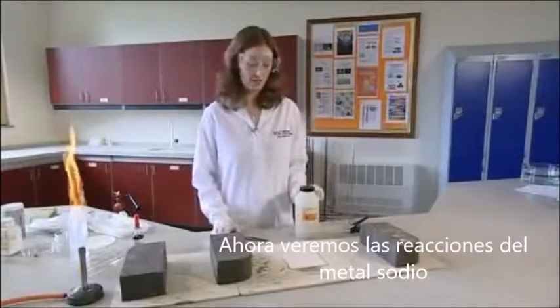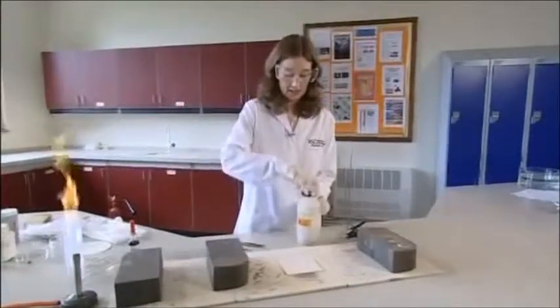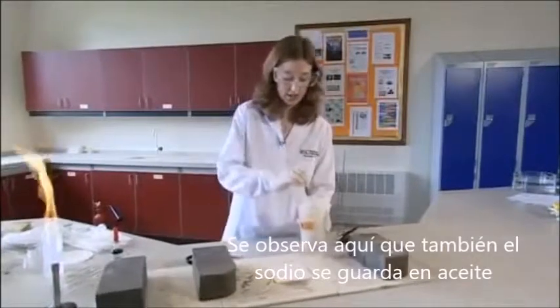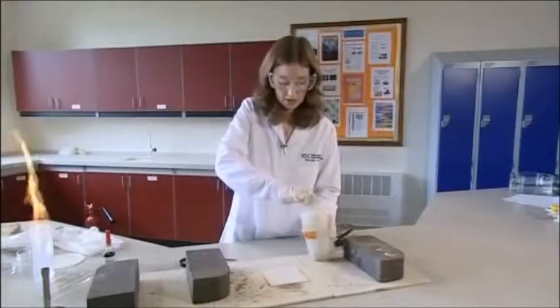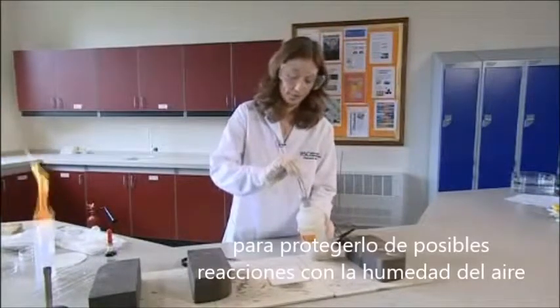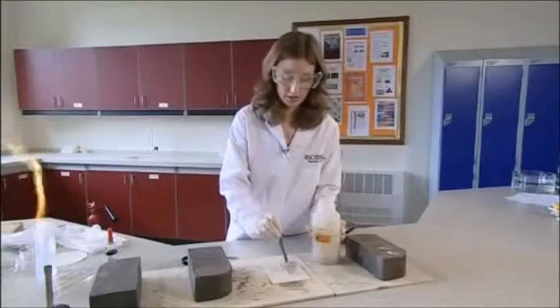Next, we're going to look at the reaction of sodium metal. Again, indicate to your class that sodium is stored in oil to protect it from reacting with the moist air. It's a piece of sodium.